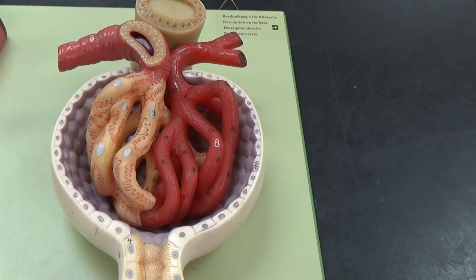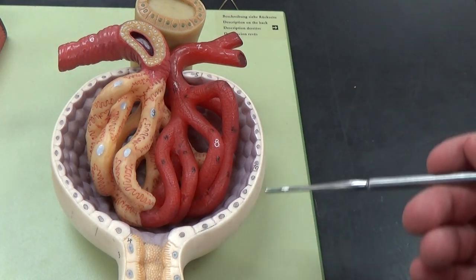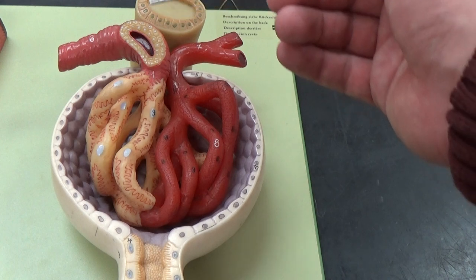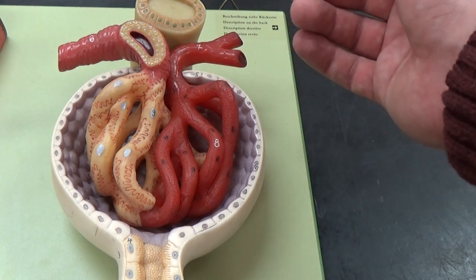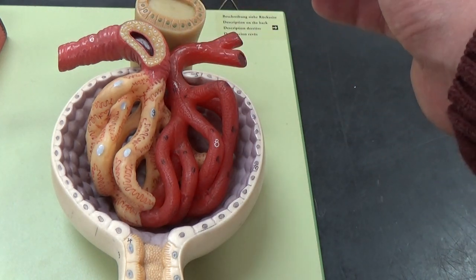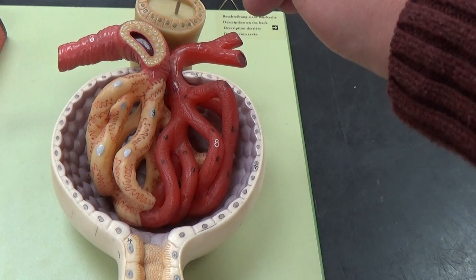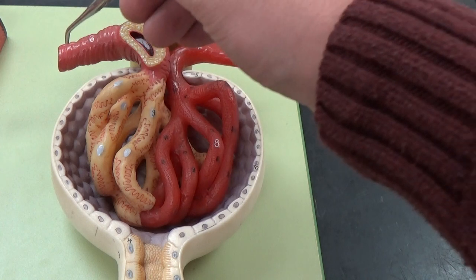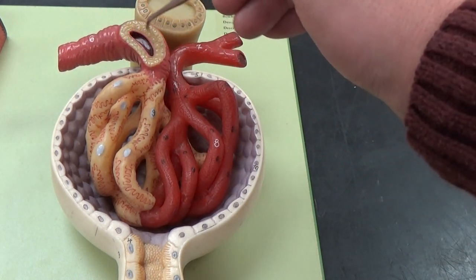We're looking at a renal corpuscle here — from here down. The juxtaglomerular apparatus is the part on top of it. In the juxtaglomerular apparatus, you have this structure up here with the distal convoluted tubules and the macula densa cells. You have an afferent arteriole with JG cells there.